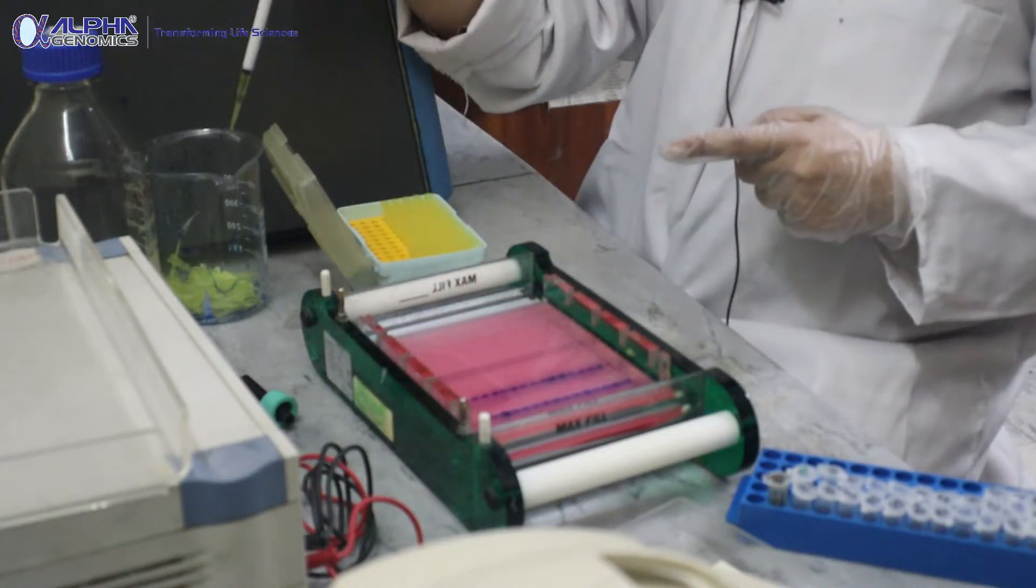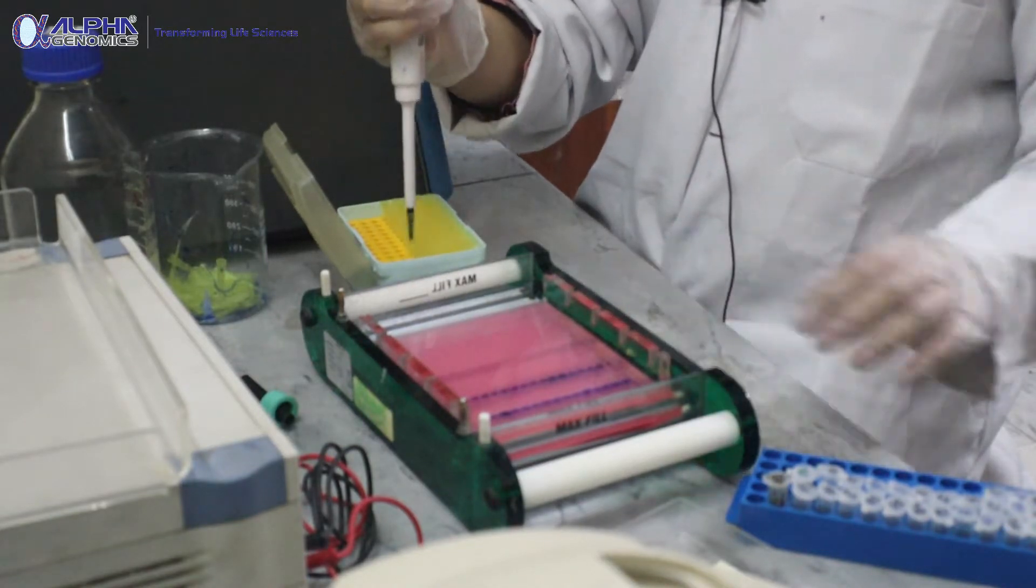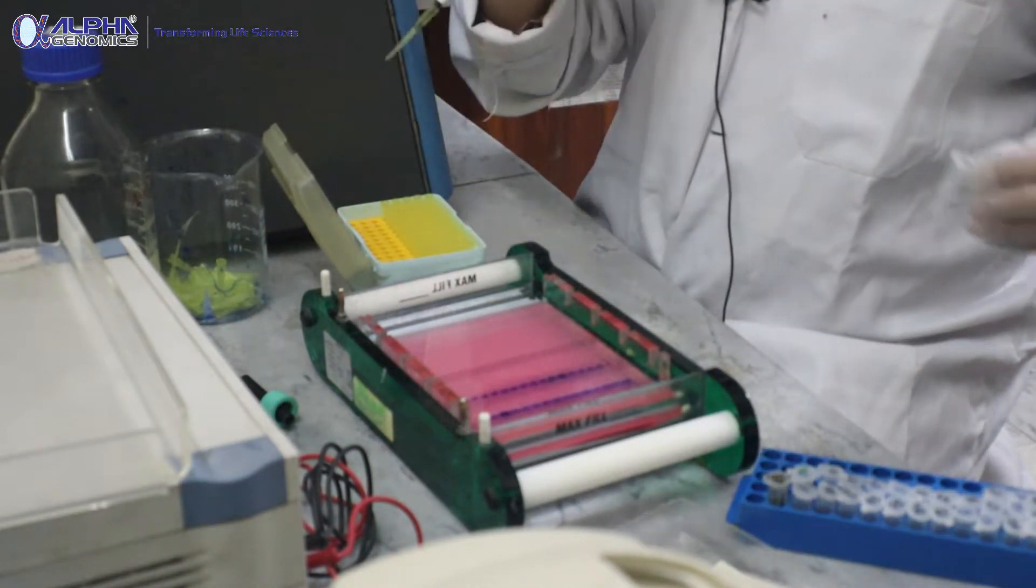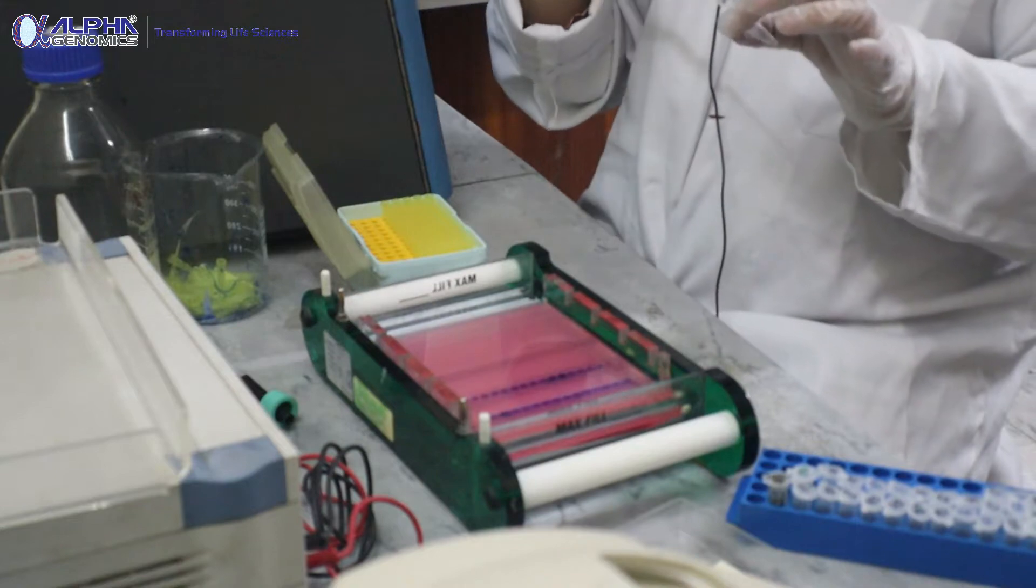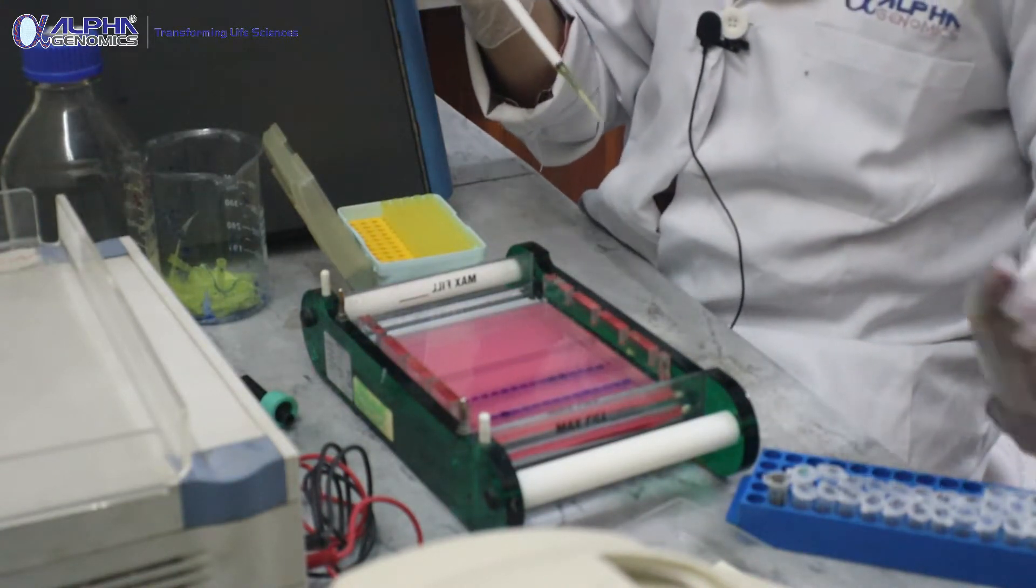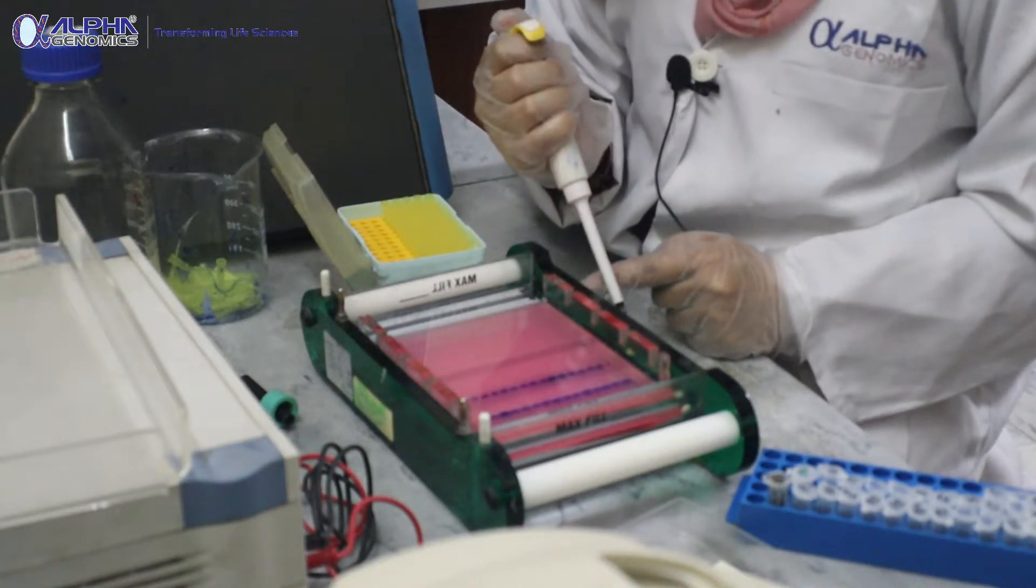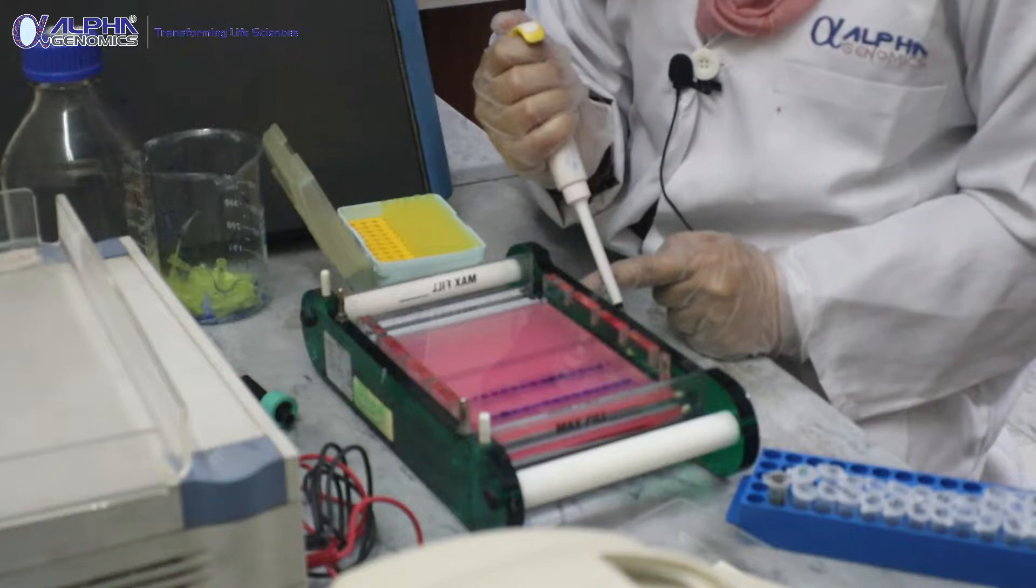It is loaded into the wells of this prepared gel. Now if we talk a bit about the gel preparation - why are we using 1% gel and how is 1% gel being prepared?